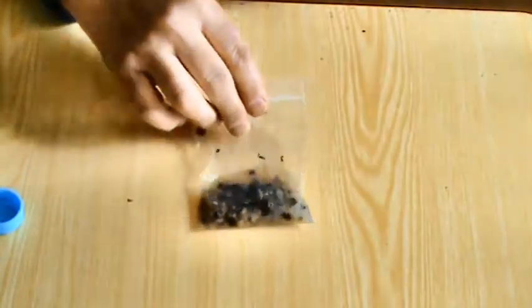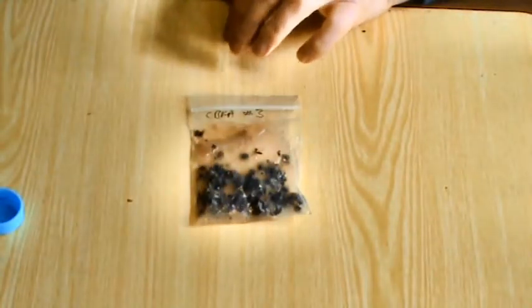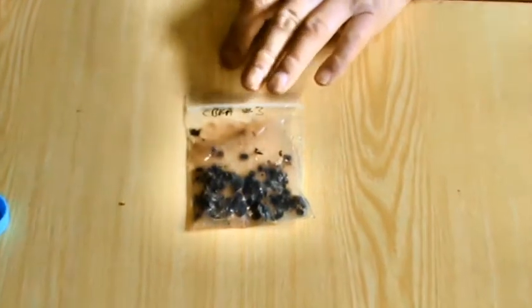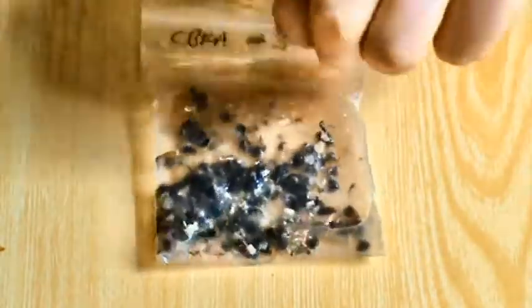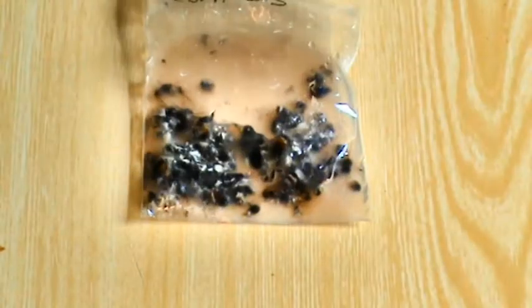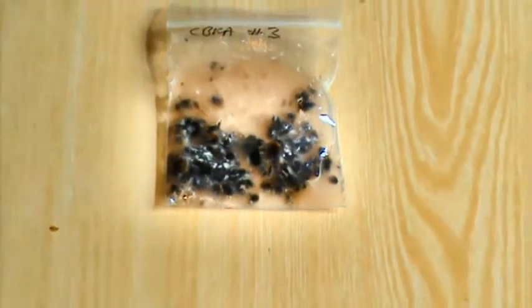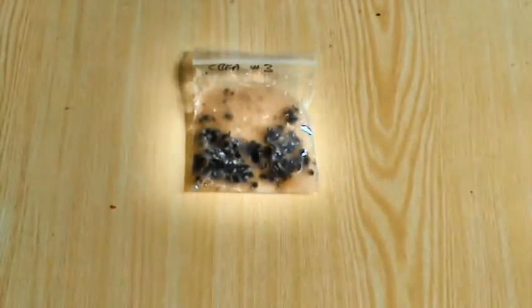So when we've got that, you can see there it is quite a gooey mess if we just zoom into that. So the bees are crushed. The water has become quite stained with the contents of the inside of the bee. And now we want to make up the slide.